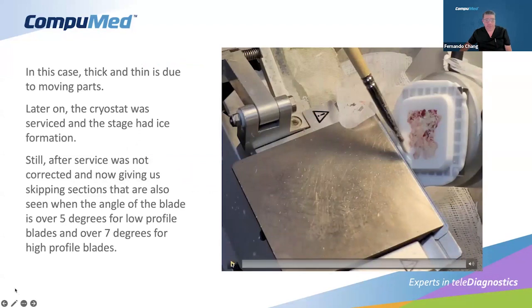This is one of our cryostats last week. We were having problems with this and we couldn't figure out what it was. We did everything we had to do on our part, but then we had to call preventive service, and it was ice formation. Normally these machines have a thawing cycle at night, so they go kind of off. There is a time when they actually defrost. That's what it's called, the defrost cycle. And this ice, this water, basically goes to a receptacle by gravity. But sometimes there is ice formation because the time in this cycle is not enough. And that was one of the reasons.